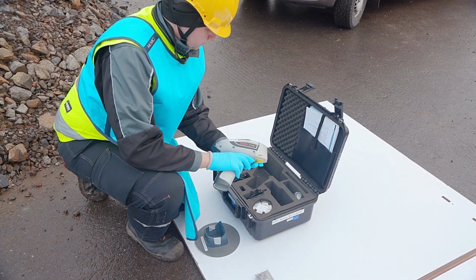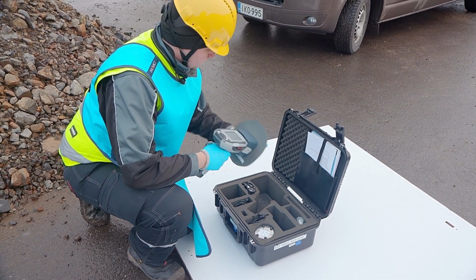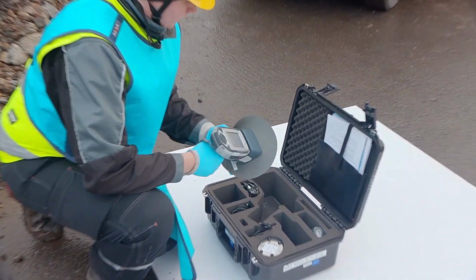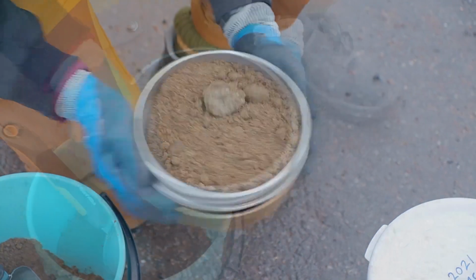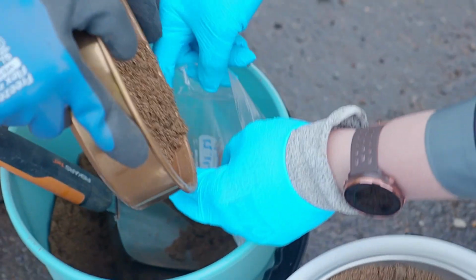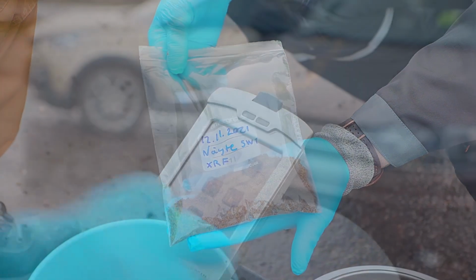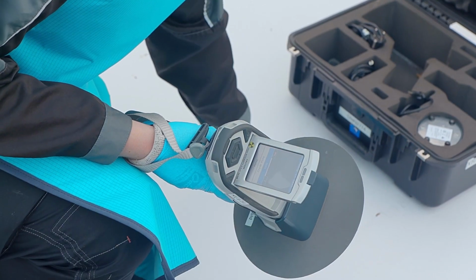Humidity, organic carbon, and the heterogeneity of the sample affect the reliability of the results. Reliability can be improved by pre-processing the samples. Pre-processing involves first sieving out large objects, such as stones and, for example, bullets, after which the sample can be homogenized and dried to remove moisture. Samples are not usually dried in field conditions, resulting in a higher measurement error in the results. The analysis itself can be done through the sample bag.